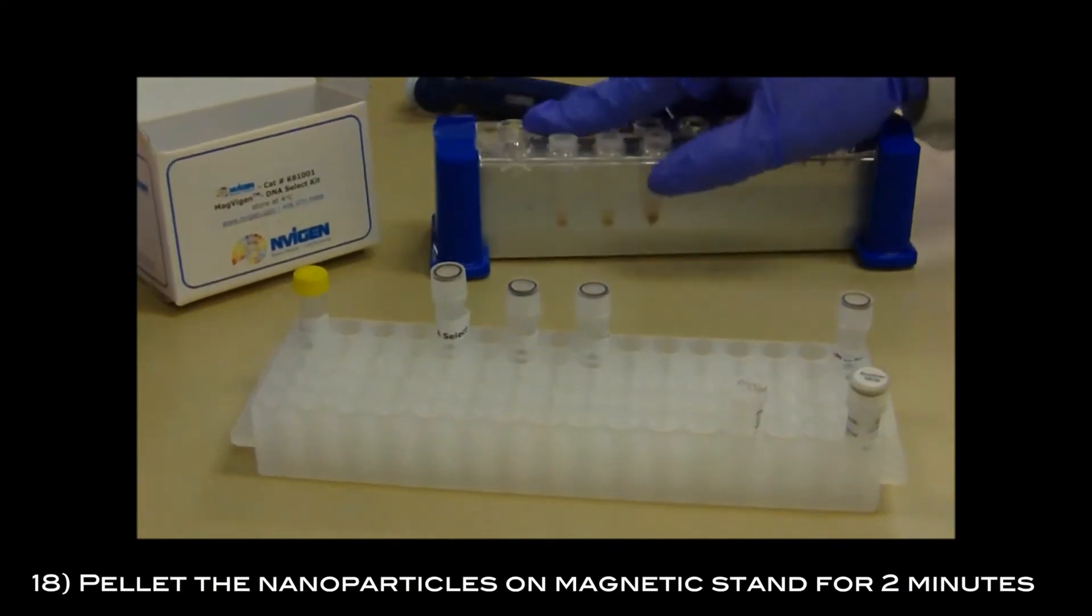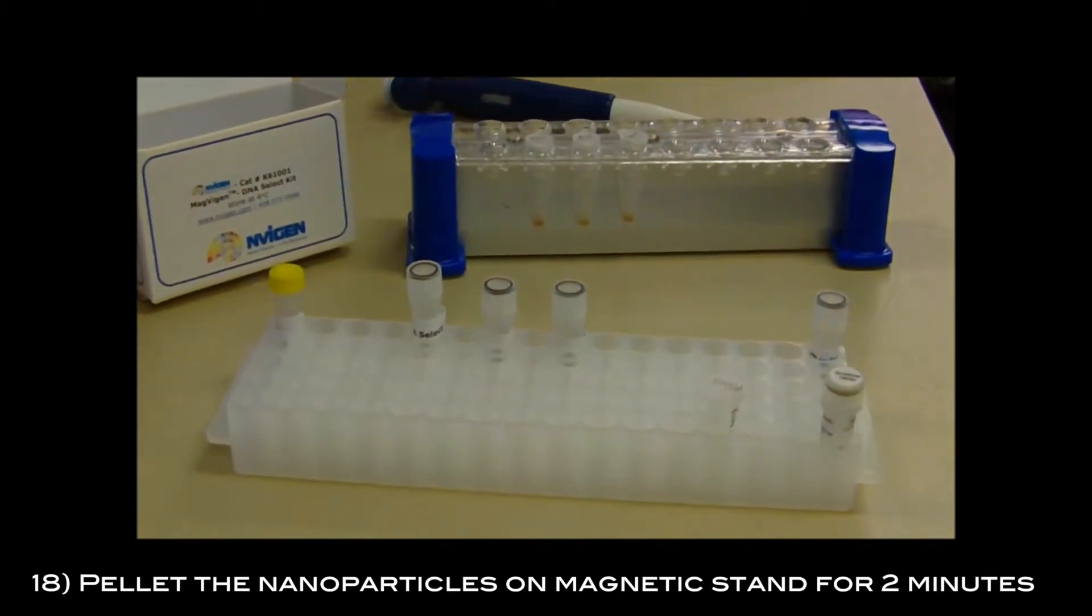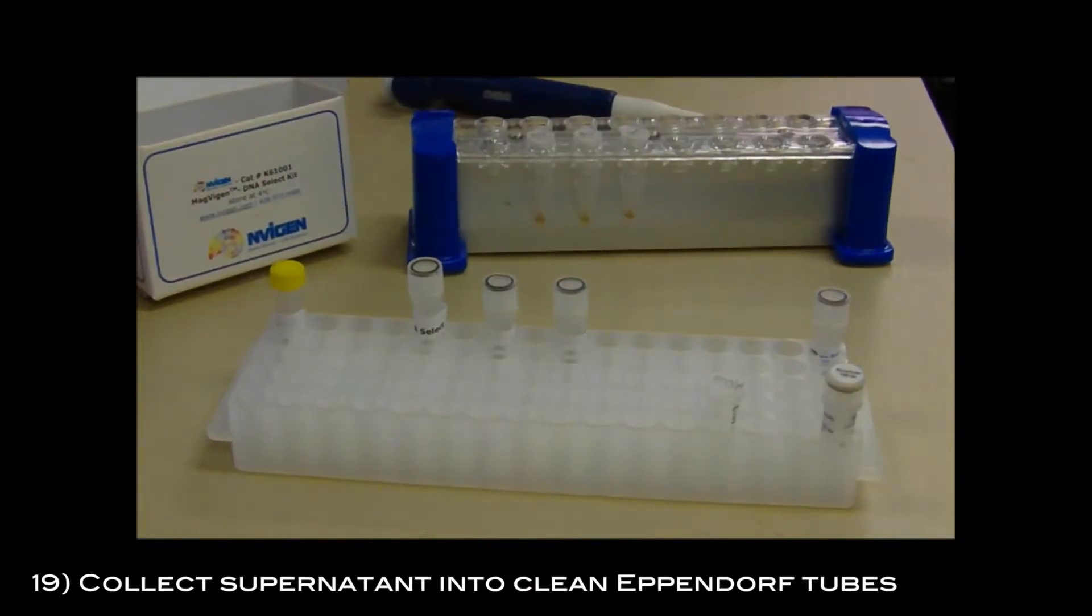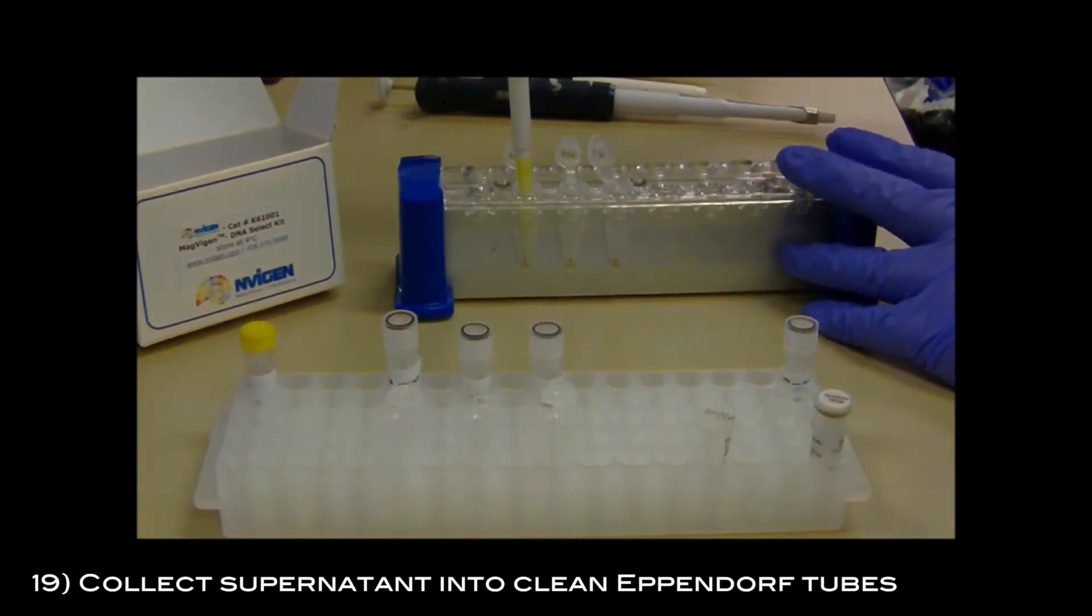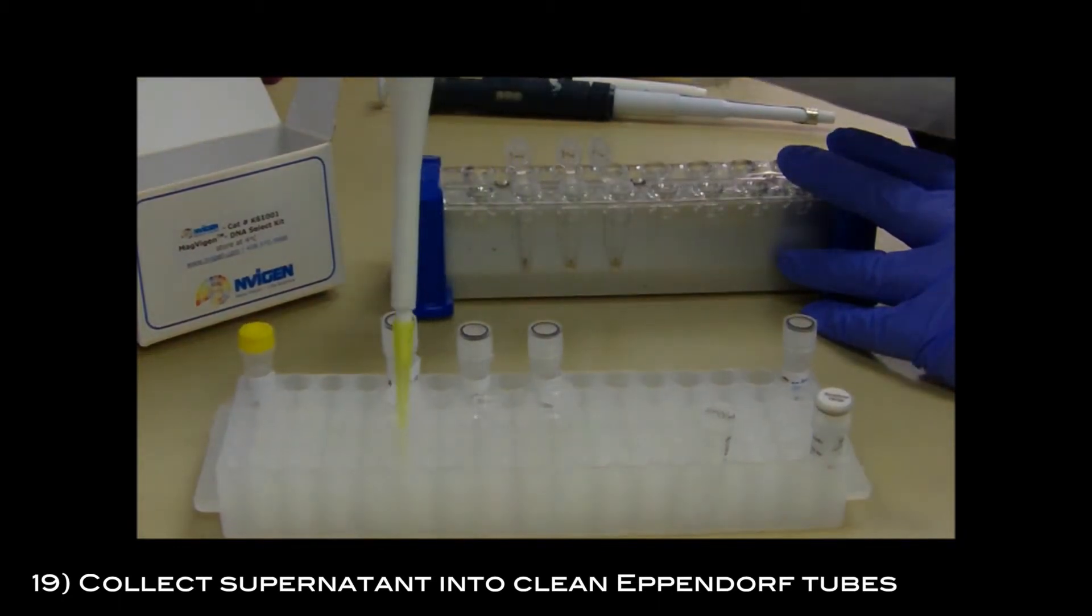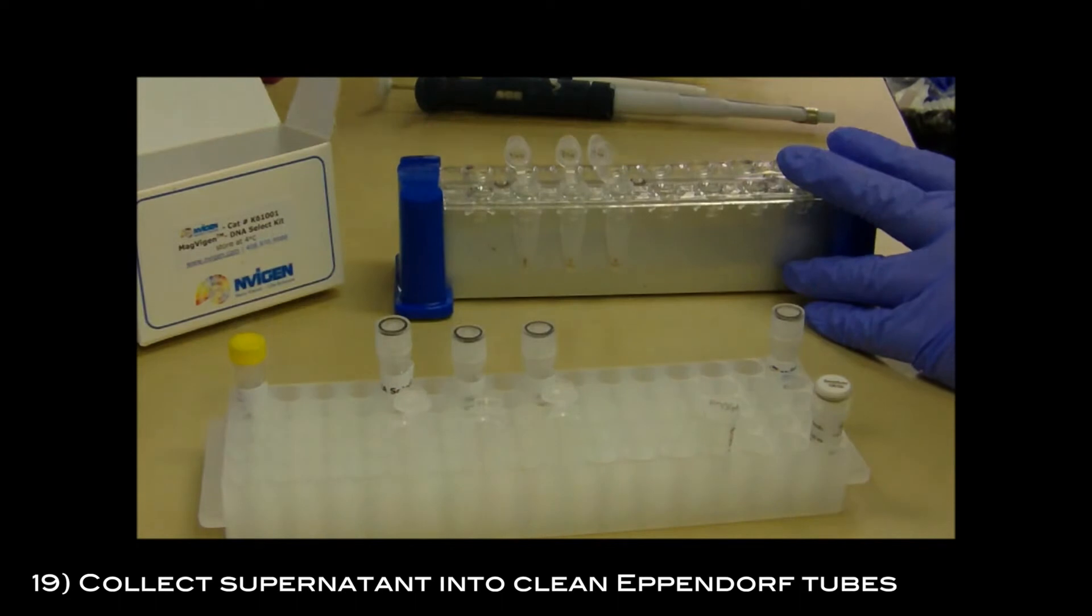Pellet the nanoparticles on the magnetic stand for 2 minutes. Then collect the supernatant into clean Eppendorf tubes. This is the size selected DNA product.